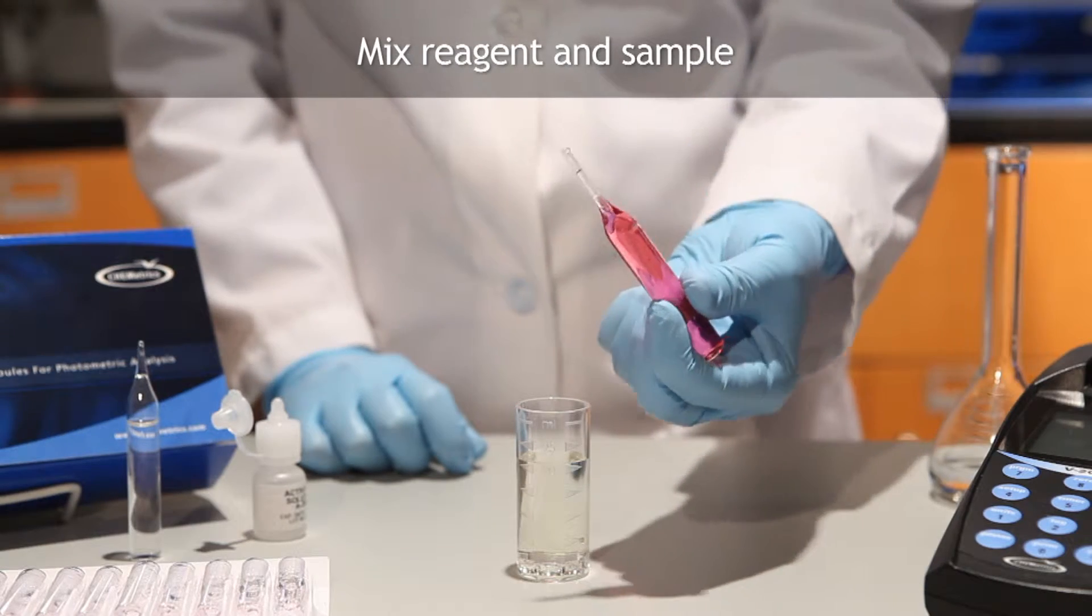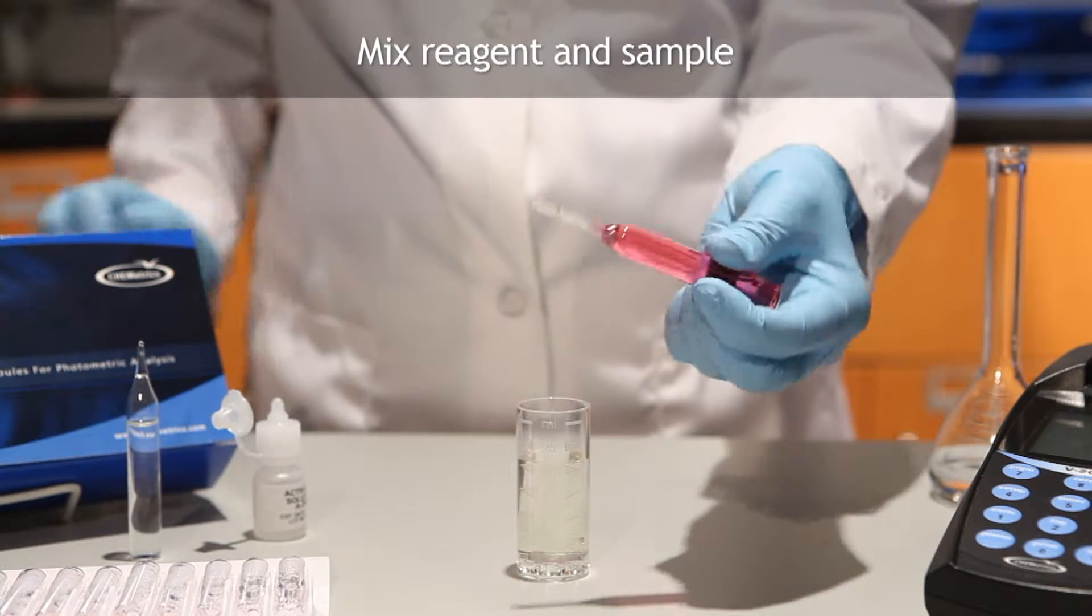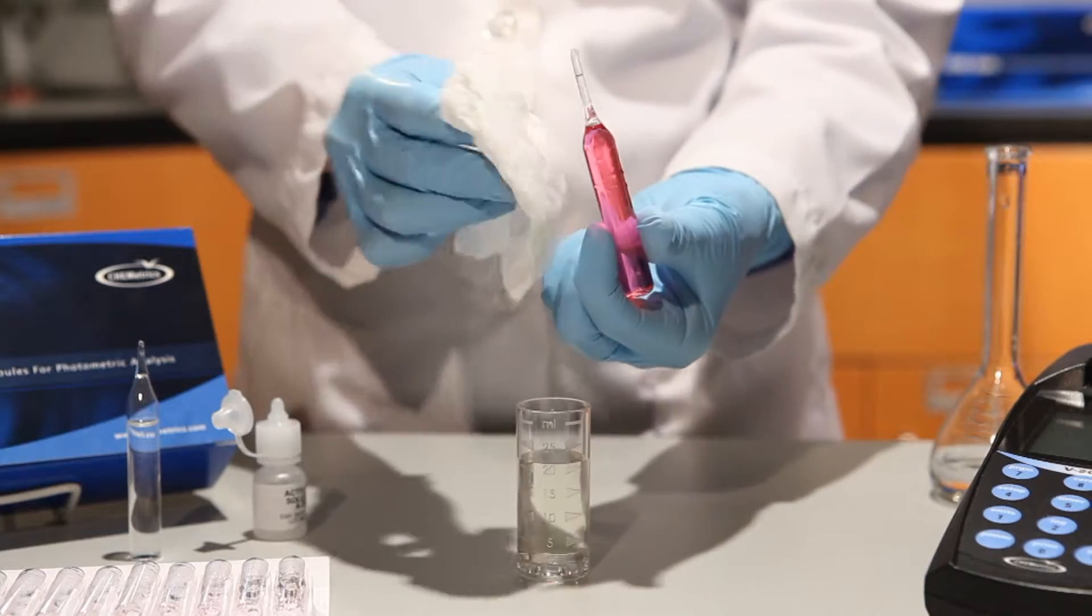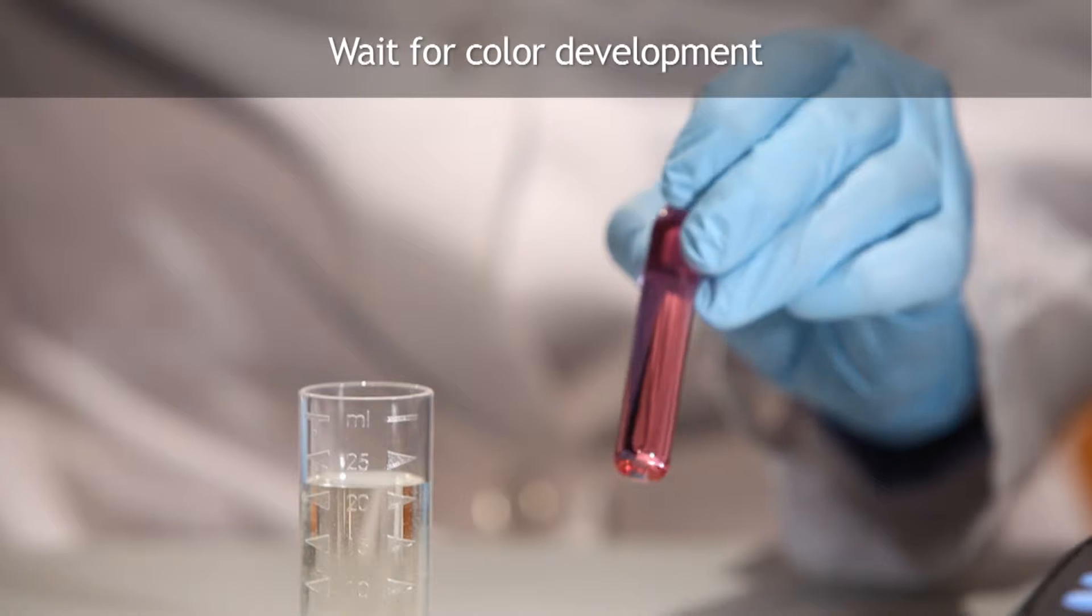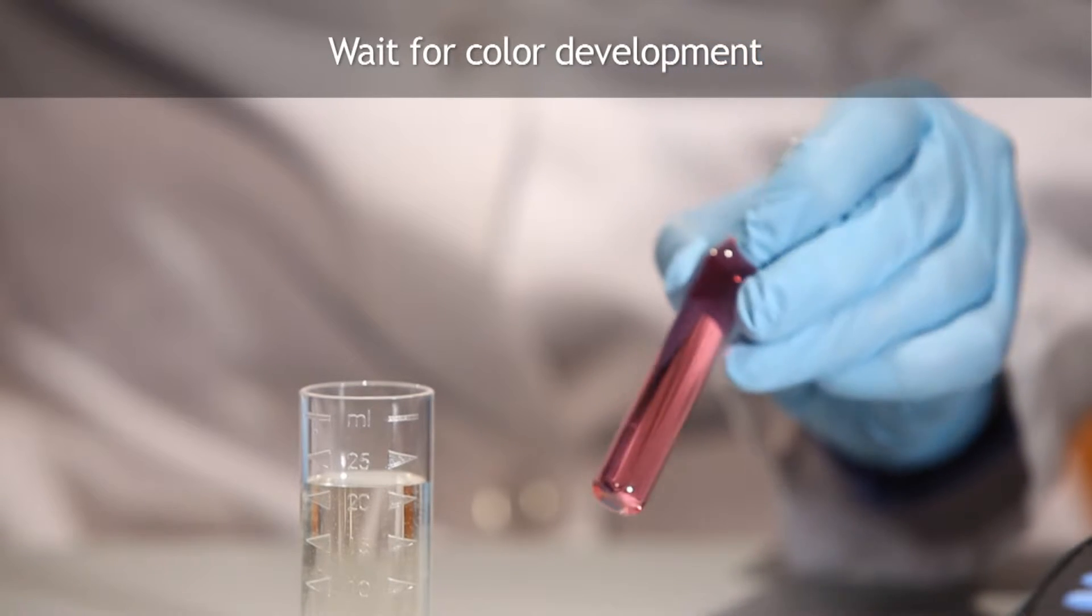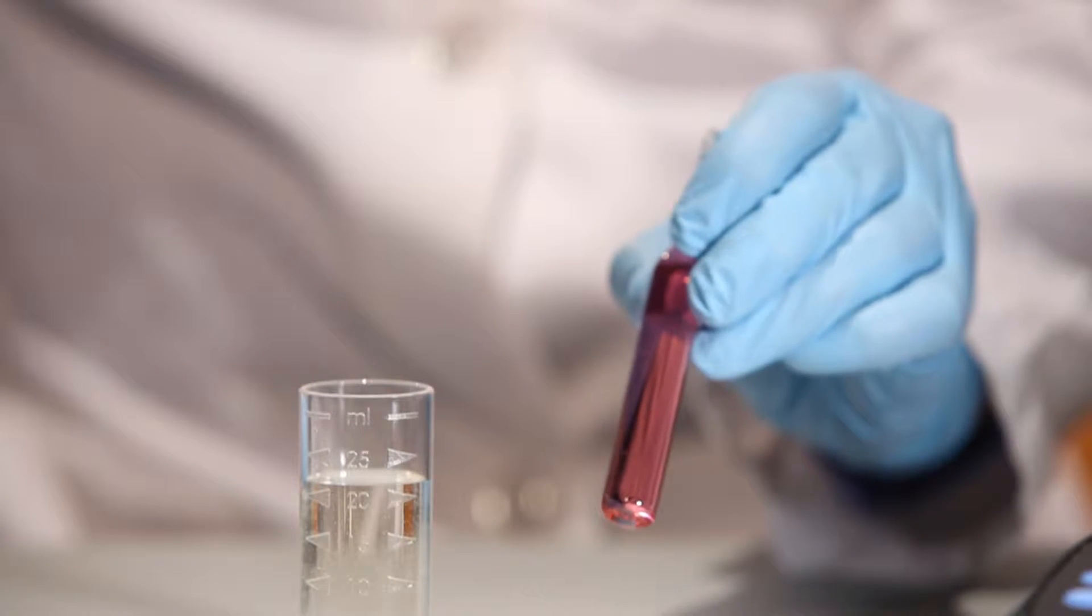Mix the contents of the ampule by inverting it several times, allowing the bubble to travel from end to end. Dry the ampule. The sample will react with the reagent to form a color. Reaction times and color will vary by method.